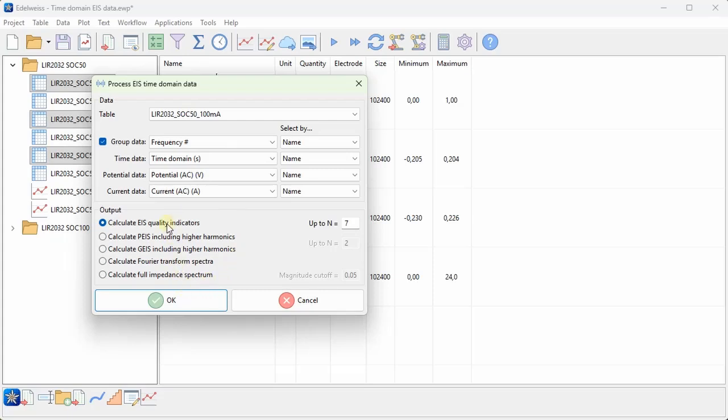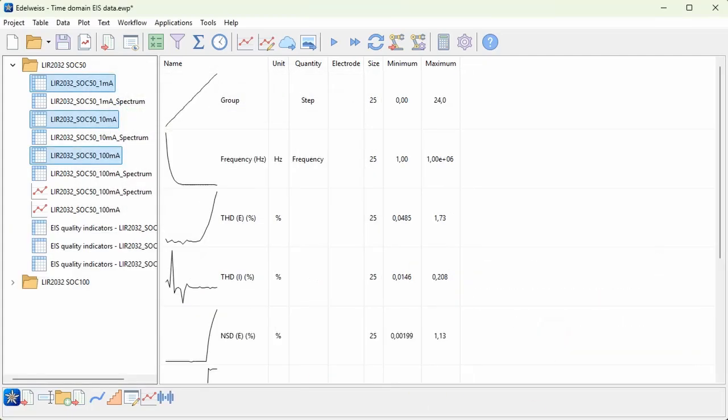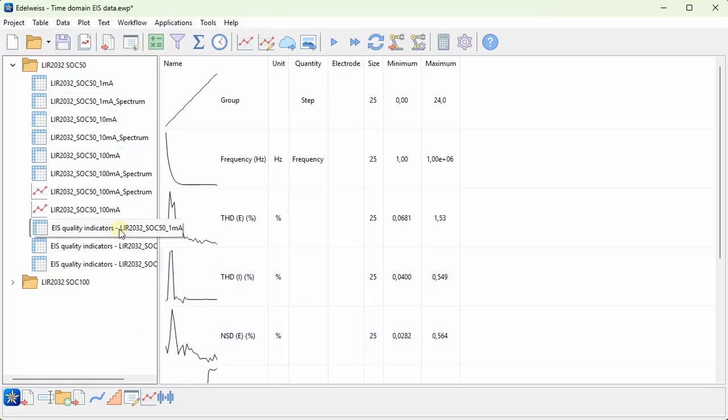And then here at the bottom we have several different options for what kind of calculation we want to do. And we'll go through each one in this video, and the first one is to calculate some quality indicators. So I choose OK and yes to do it for all the tables. We get one new table for each of the raw data tables.